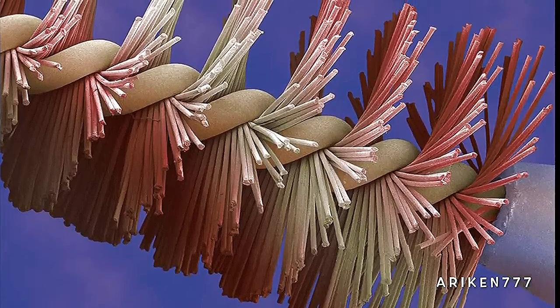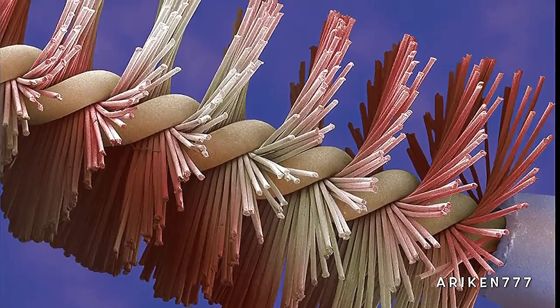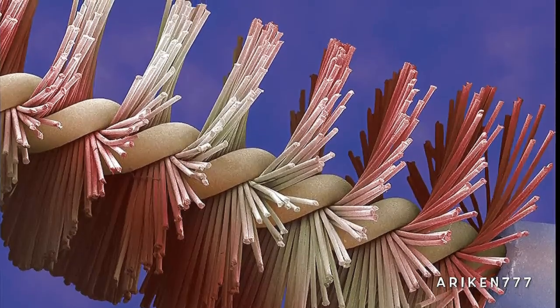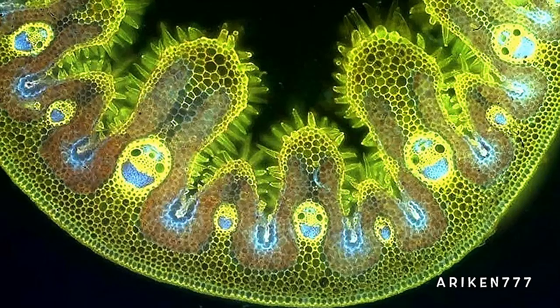A close-up of a mascara brush. A cross-section of blade of grass. The smiley faces are channels that water is drawn up through.